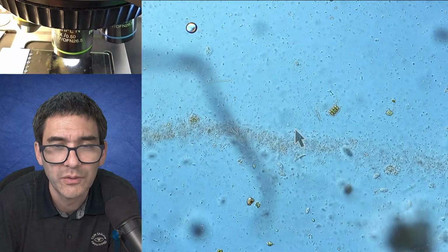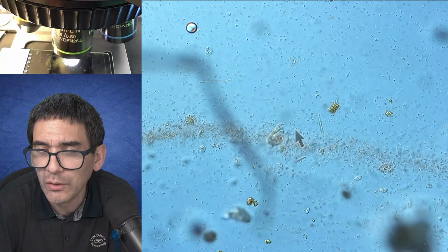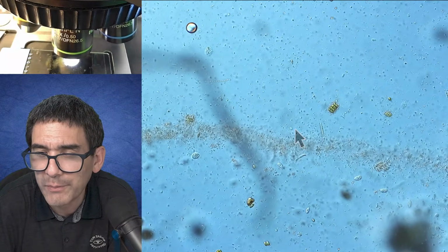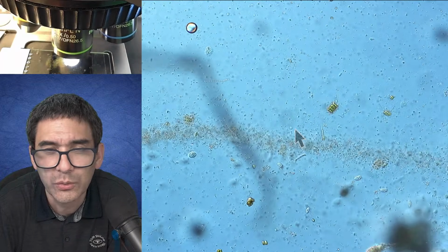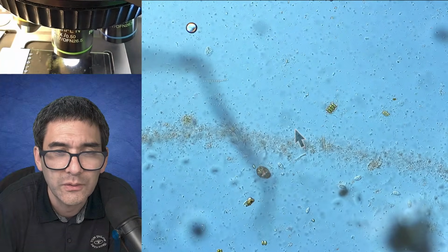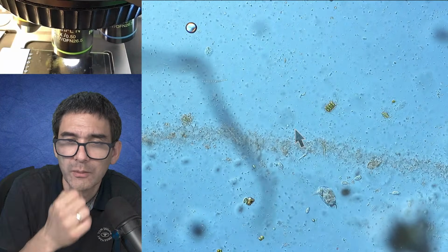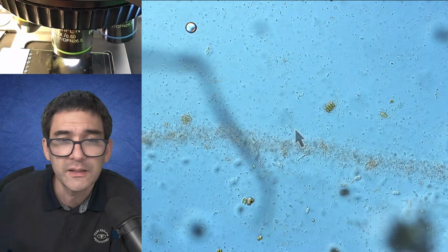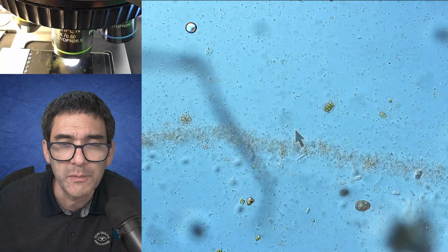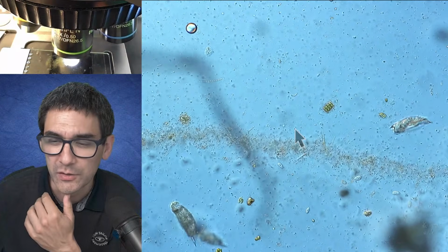Just in case you're wondering, what is this bacterial line? I came up with the term bacterial front, like a weather's cold or hot front. It would be interesting to actually come up with a term here. Again, you have to be patient to be able to actually see them move, and I've already made some time lapse videos of this as well.